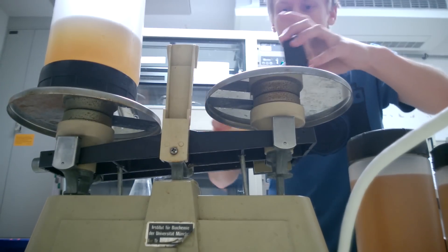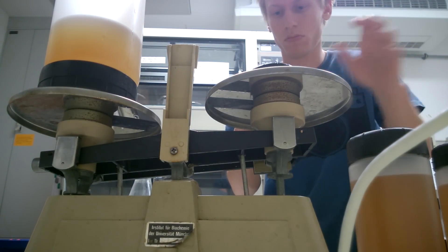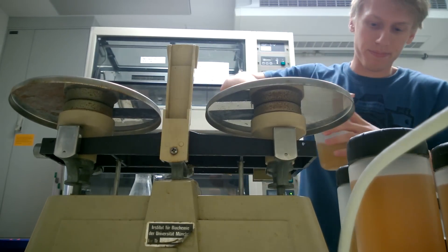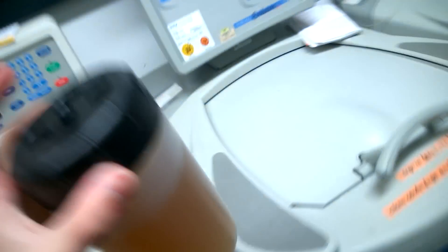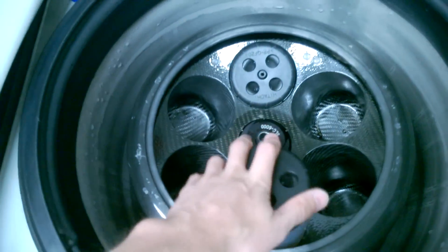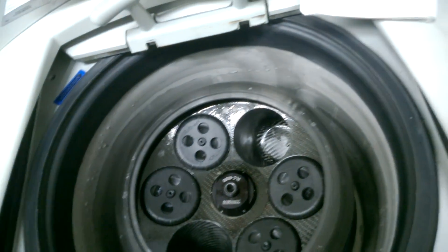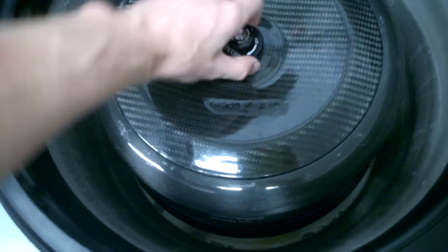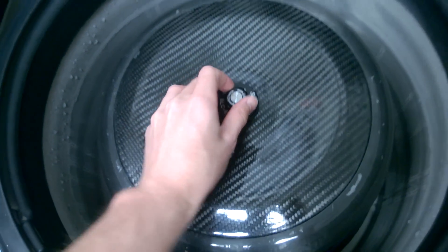So only four cups this time. Now I'll show how I put them into the centrifuge so you can see the rotor yourself. It's a cooling centrifuge, which is making all that noise — it's constantly cooling down to four degrees. Here we go — opening up the centrifuge and putting them in. As you can see there are spaces for six, made out of carbon. It's important that you place the ones you balanced opposite each other, otherwise the whole balancing wouldn't make sense. Put the top on, screw it closed.